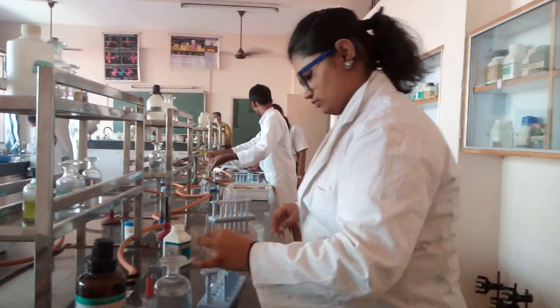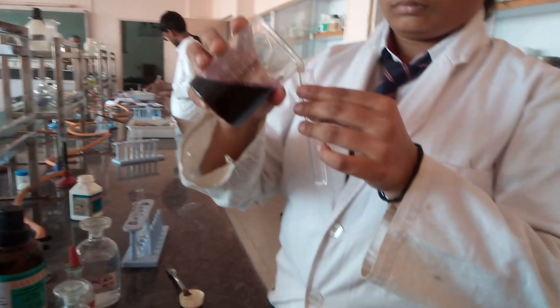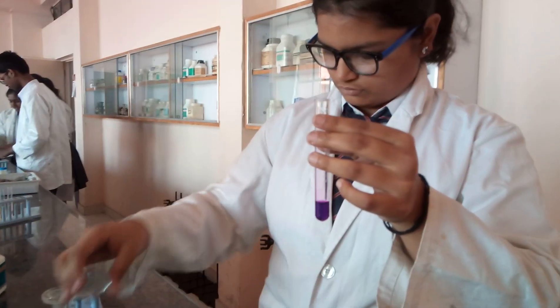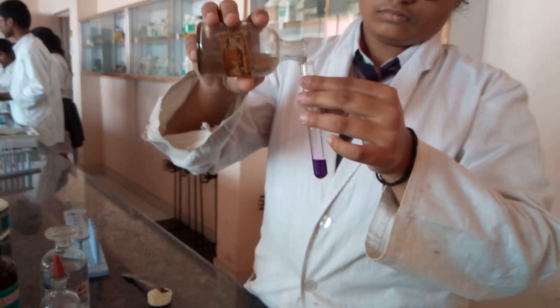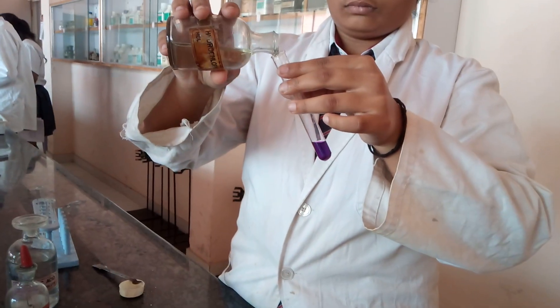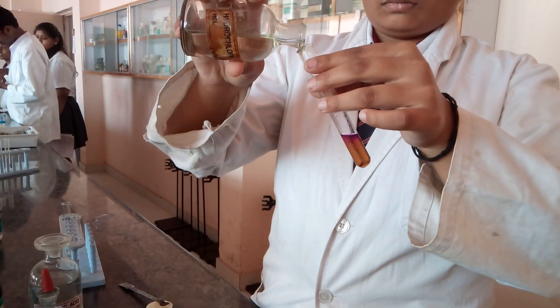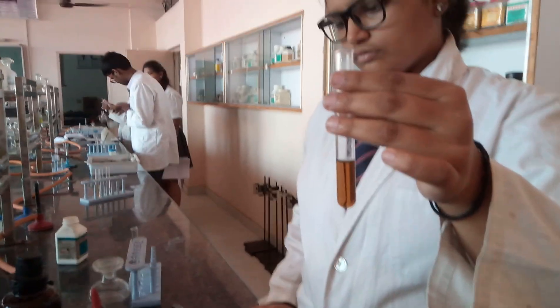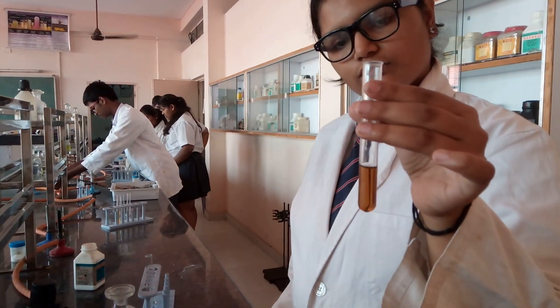Now you need to add chlorine water to it. Chlorine water is not available in the lab, so you need to prepare it. You will use approximately 1 ml of KMnO₄, which is a purple colored solution. To this, add concentrated HCl until the color changes. Keep adding concentrated HCl till the color changes and it settles. Your resulting solution is your chlorine water — KMnO₄ oxidizes the HCl into Cl₂, which is the required oxidizing agent for the organic layer test.